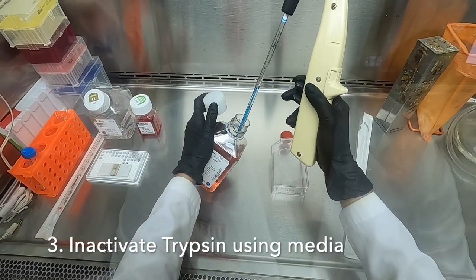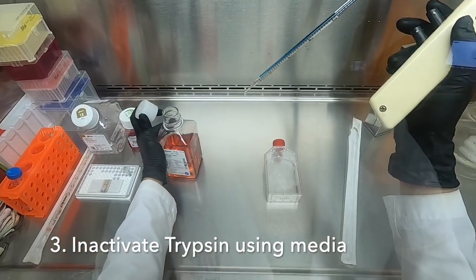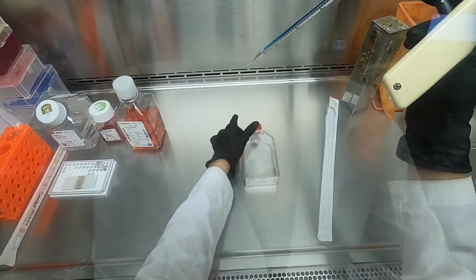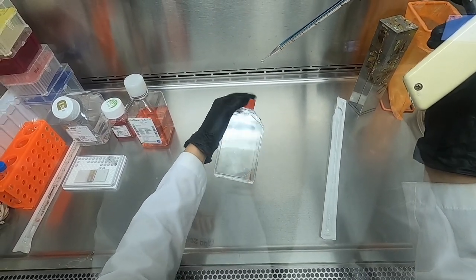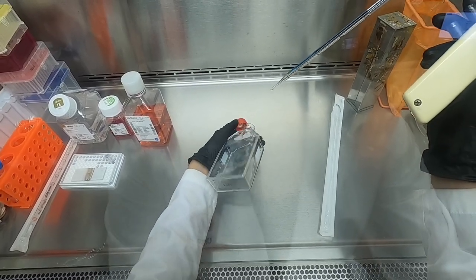Then, we inactivate the trypsin using complete media containing FBS, making sure that we achieve a single cell suspension.